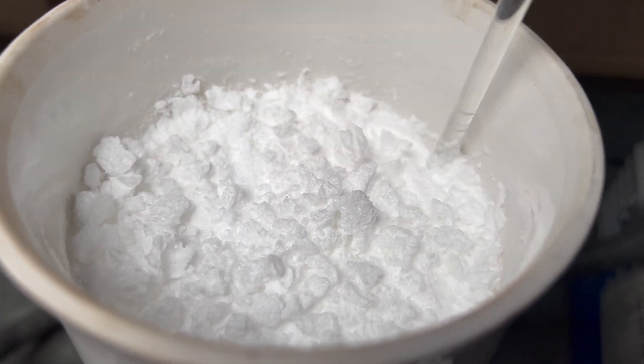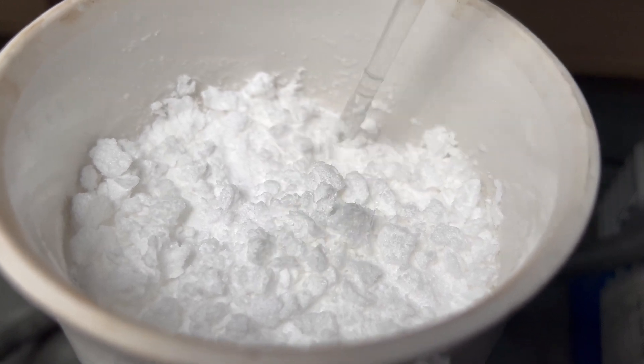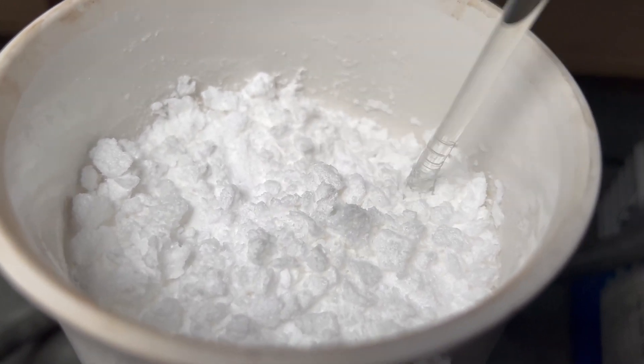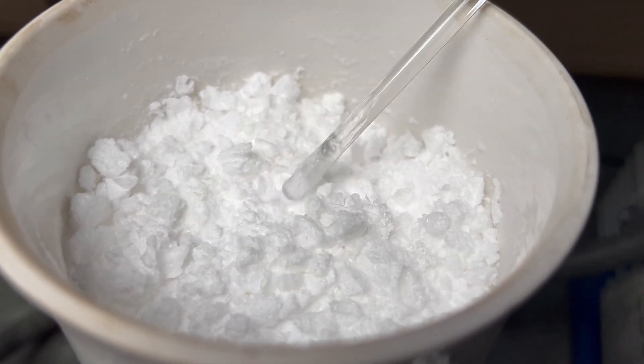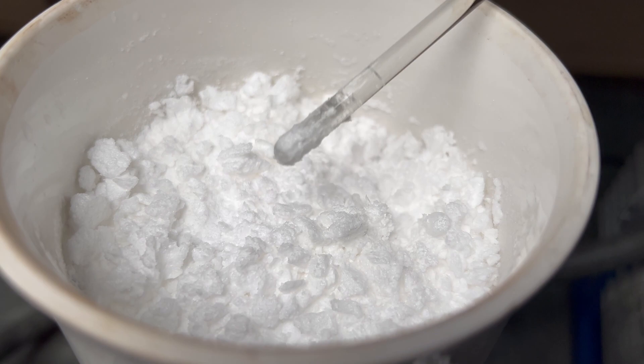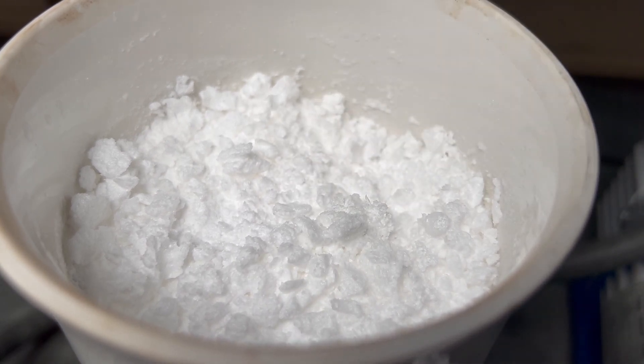I left the vacuum pump on and moved the benzoic acid around on the plate to dry it as much as possible. After that, I dumped it out into a petri dish and threw it in the drying oven. After the drying process, we were left with our pure benzoic acid.